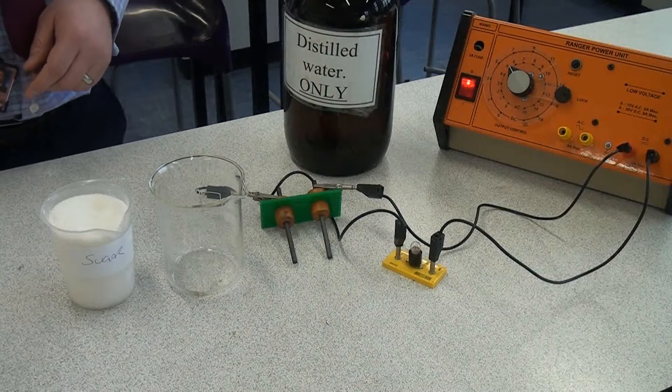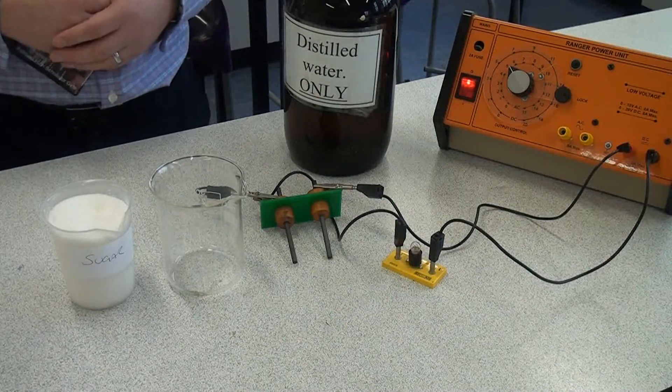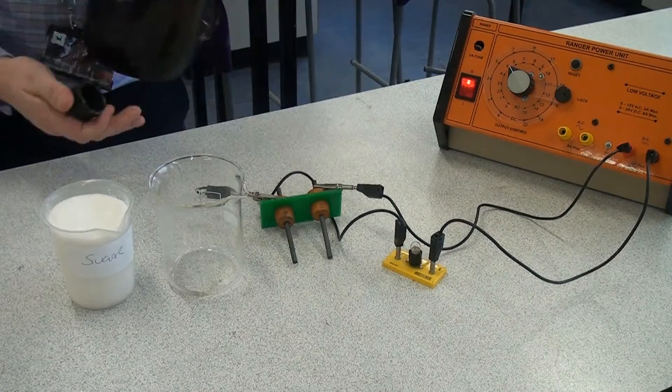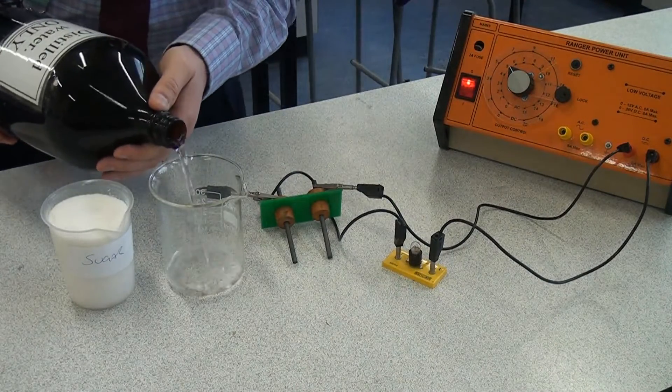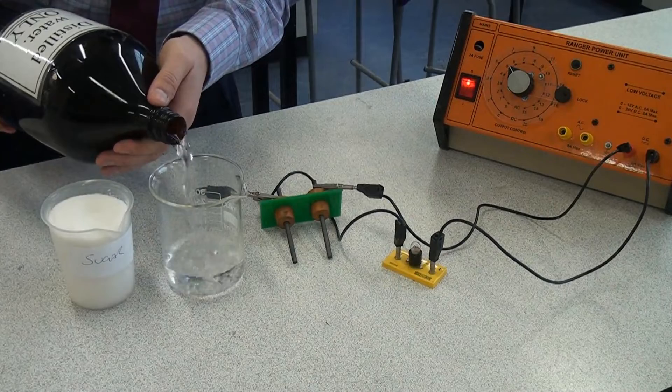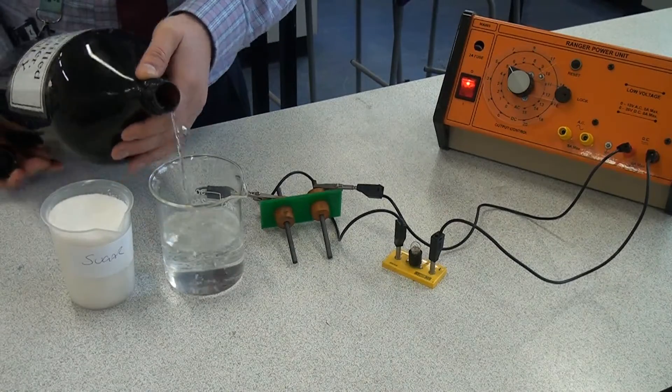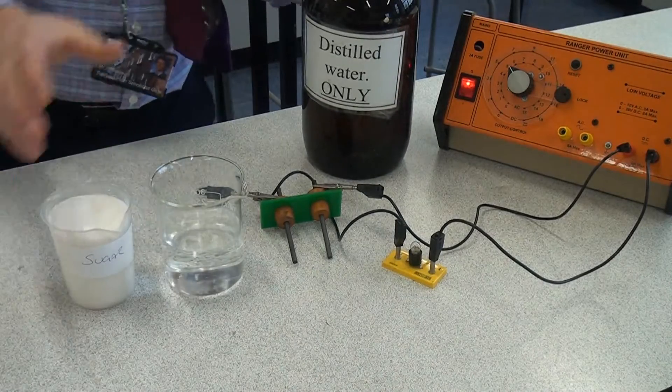This time we're going to see if the sugar, the small covalent compound conducts electricity when it's in solution. So I'm going to put some water in the beaker here and I'm going to add some sugar to it and give it a good stir to make it into a solution.